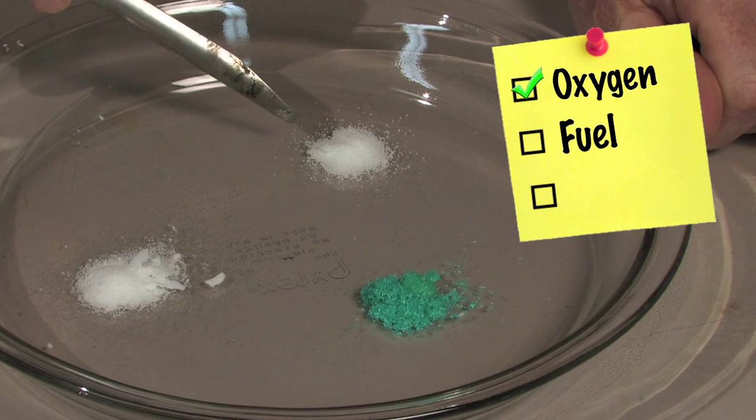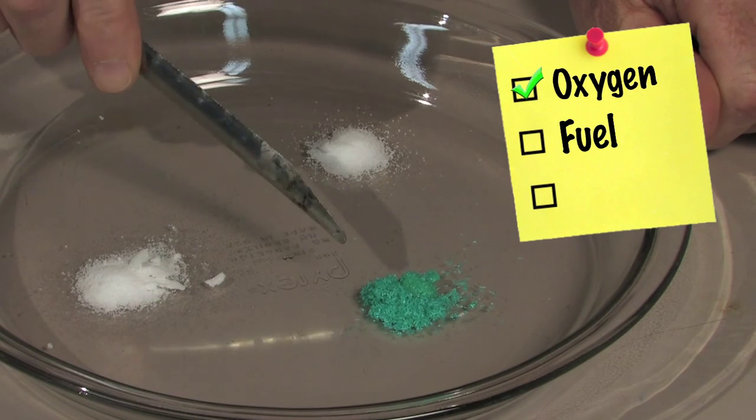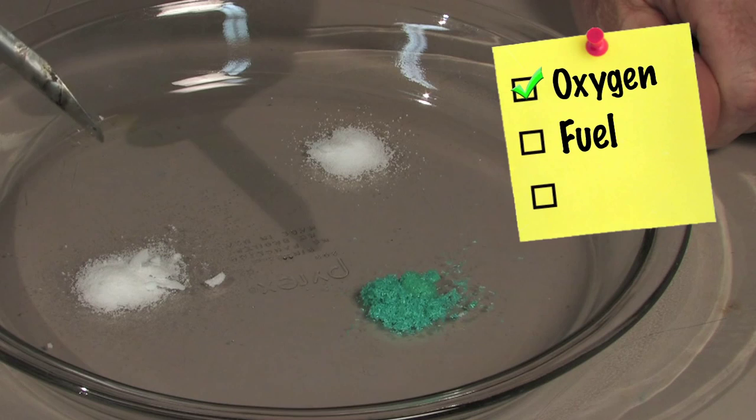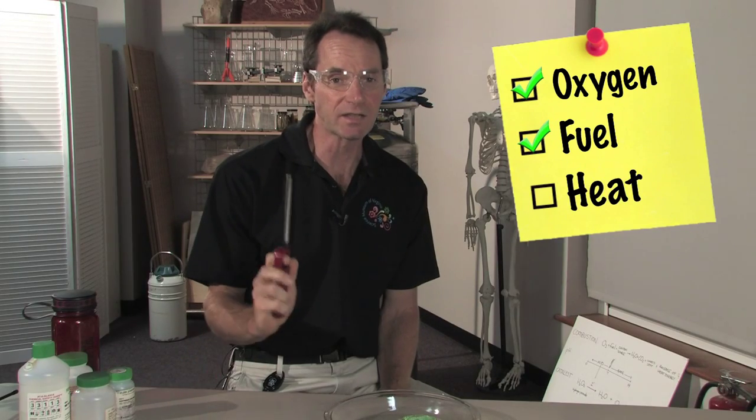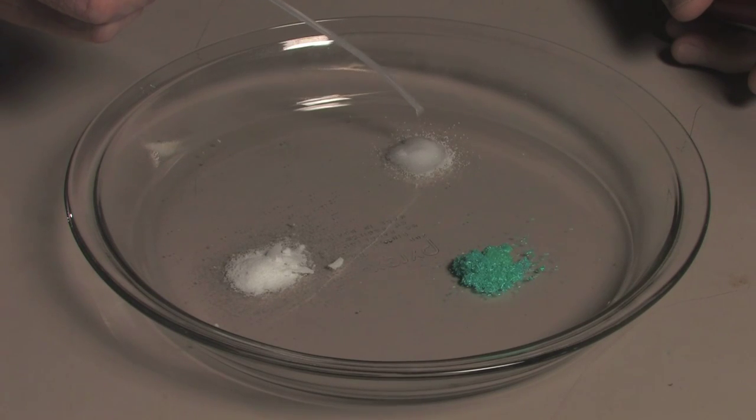Here's our sodium chloride or common table salt, copper chloride, and lithium chloride. And finally, we need a heat source. I've got my grill lighter. We're going to add a little more fuel with some methyl alcohol.